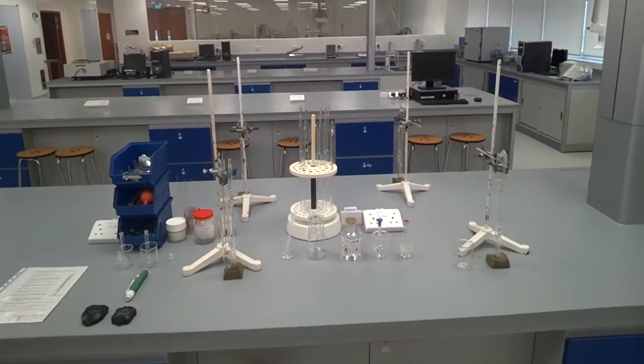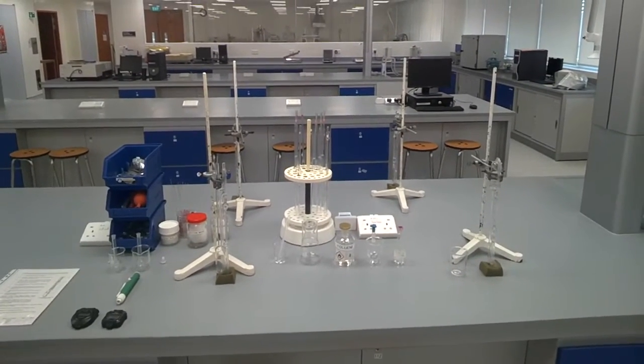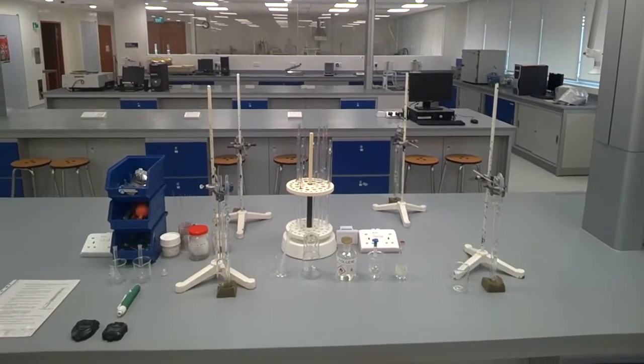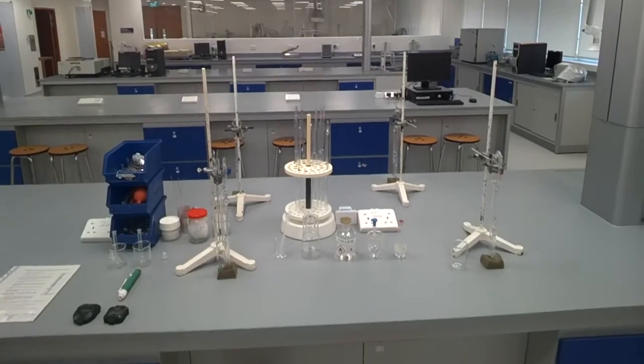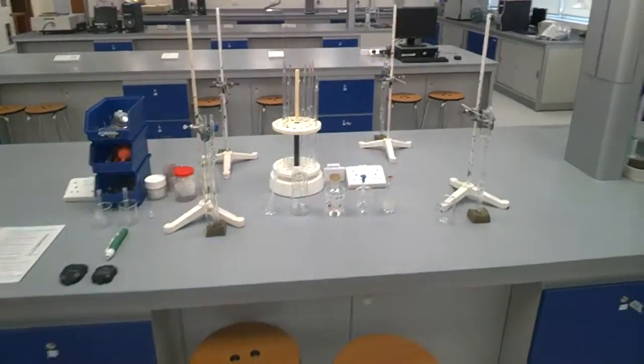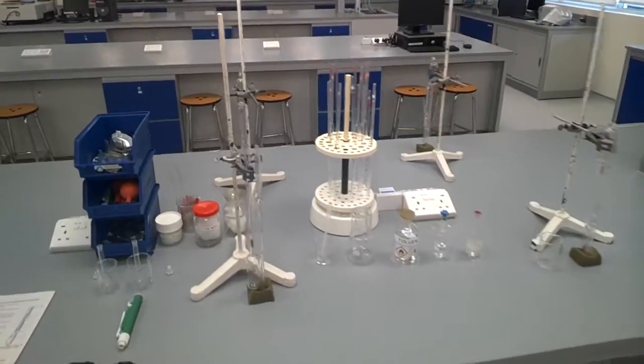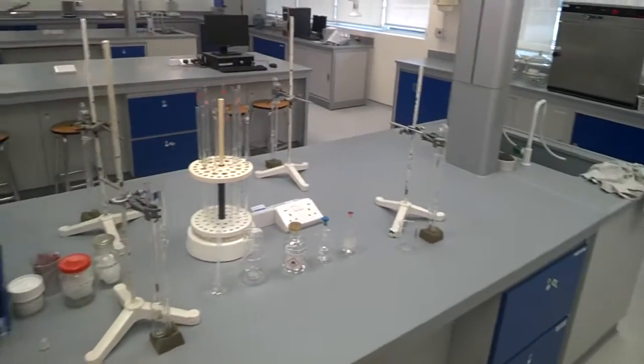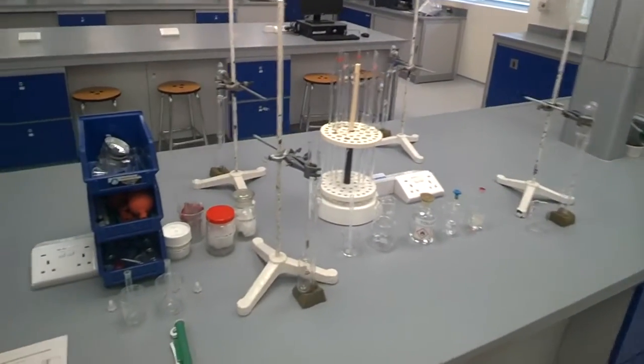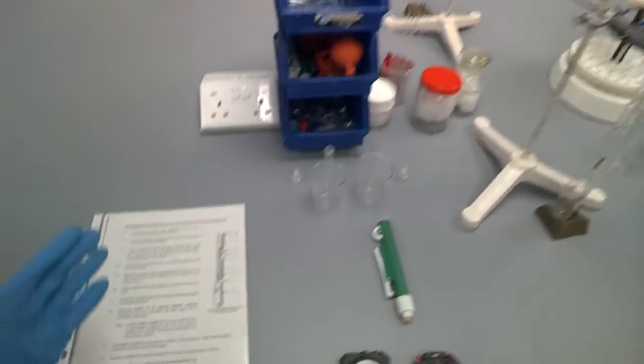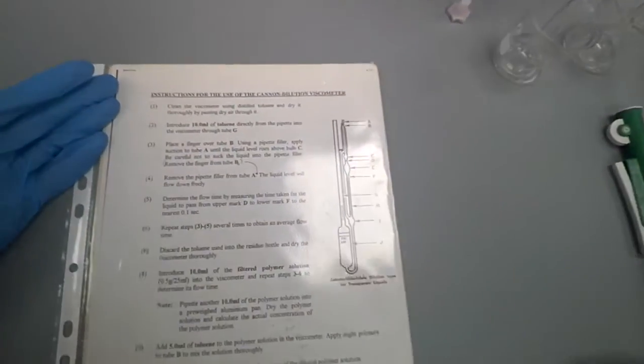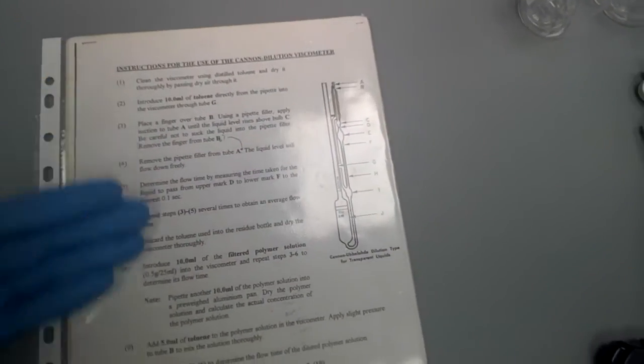Okay, it's me again. Morning guys. So here in front of you see a setup to measure the viscosity of polymer solution. Now first up, as usual, you need to have your PPE on. Gloves must be ready on your hands, and I'm going to bring you through what are the equipment you need and apparatus for this measurement. First up, you have your instruction manual in case you forget the theory and what to do.